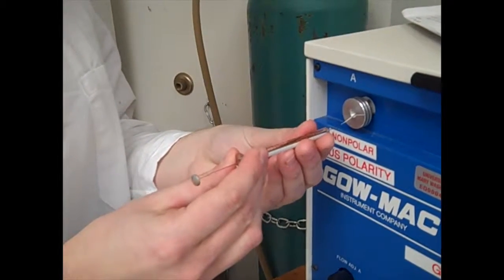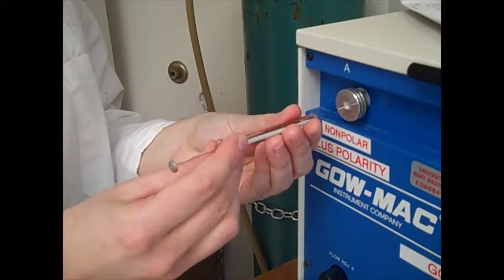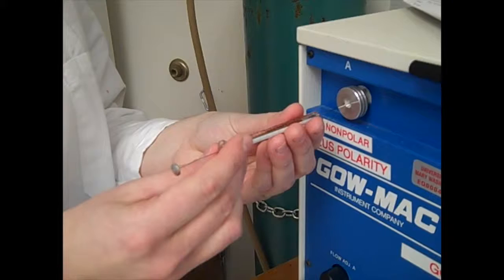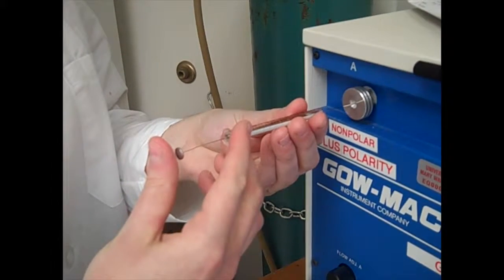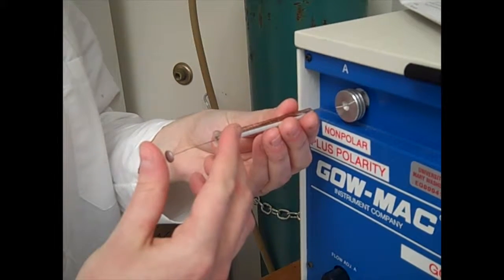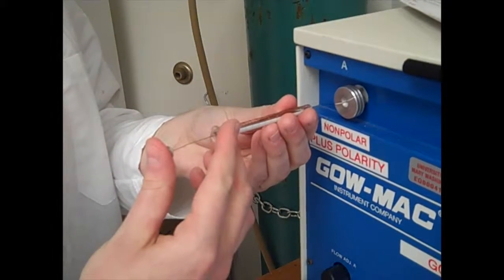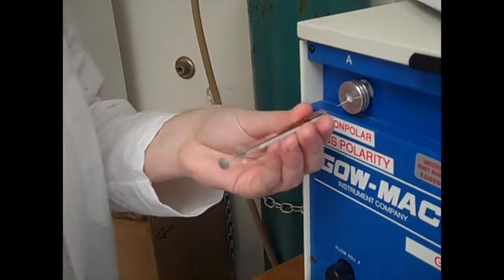Insert the syringe into the port, pushing as far back as possible without jamming the needle, as this will bend the needle. Once the syringe is as far back as possible, place your finger or hand behind the syringe arm to make sure the syringe arm does not fly backwards. Quickly push the syringe arm forward while pressing the start button.